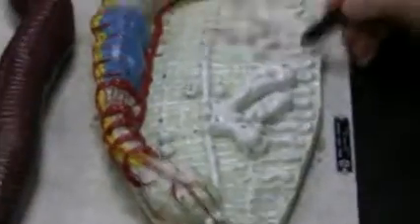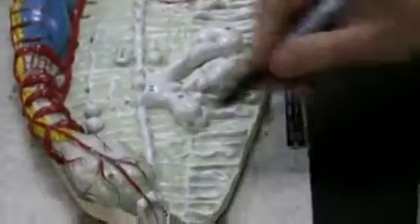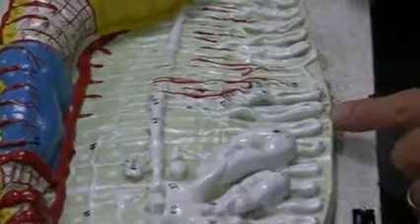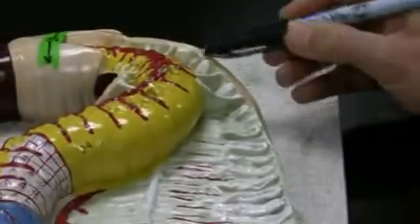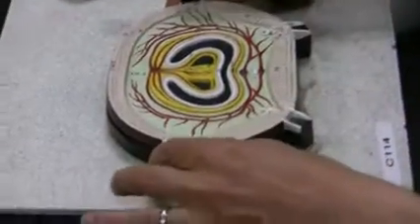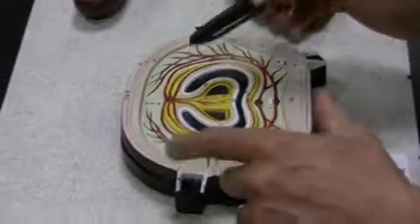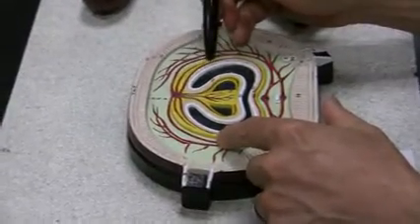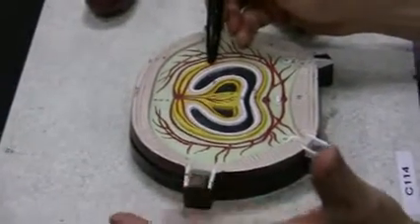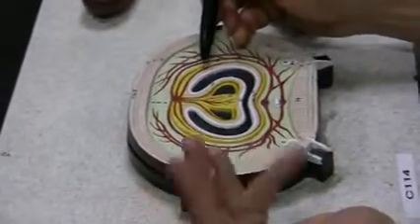Receive, receptacle, receive. Nephridia. In each segment there is a nephridia, and this is a septum, for example. That line is a septum. They're showing you septum here, septum here, septum here. So after you dissect, you see it like that. Cross section, 4 pair of setae. These are setae. The yellow is chloragogen. That was a quiz question today, something like that, or it was not. It was a decoy. I don't know.